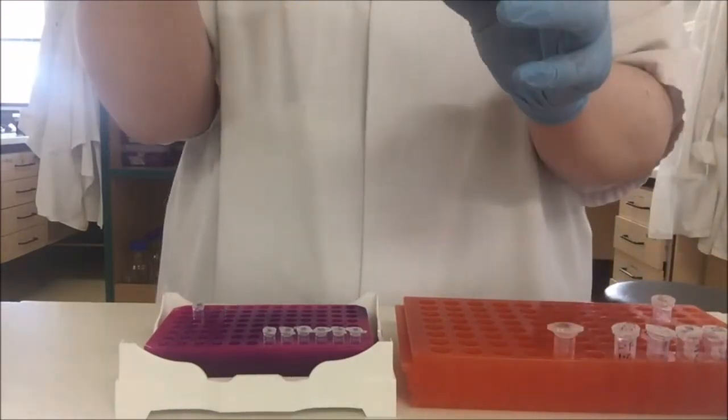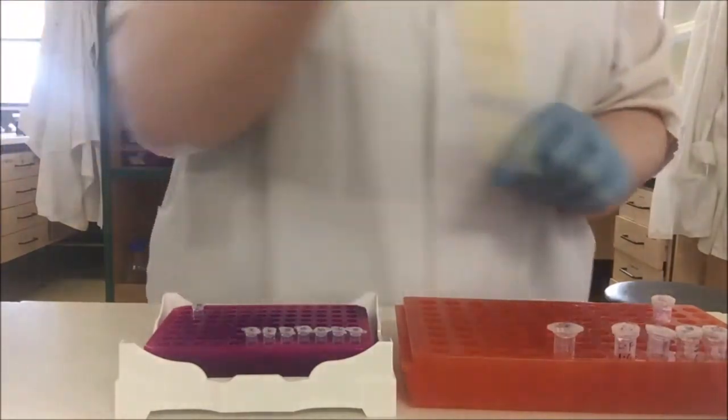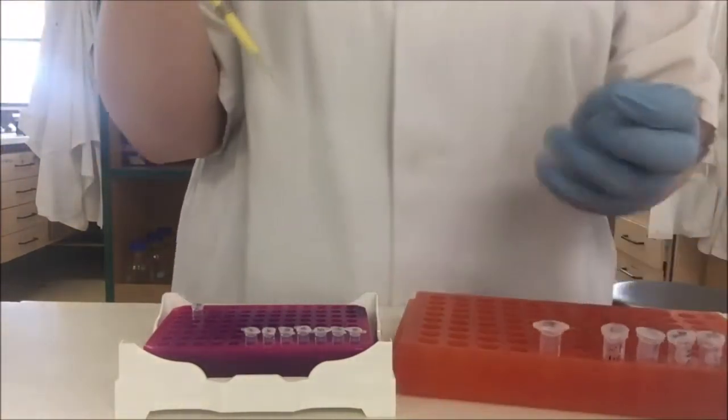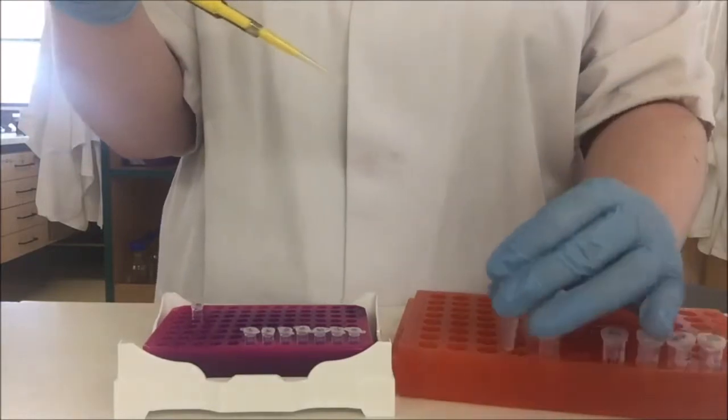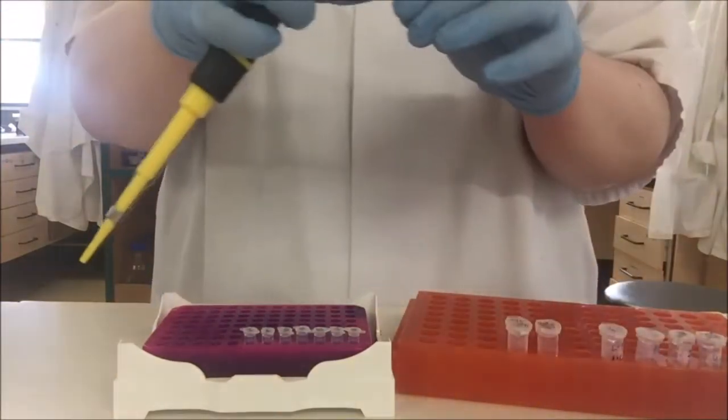So I've done our 6 class samples. And then I have our 7th, which is a mealworm beetle I know will work. And a water sample, which I know won't work because there's no DNA in there.